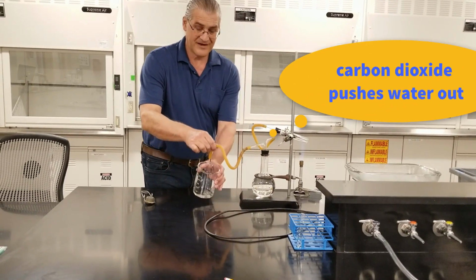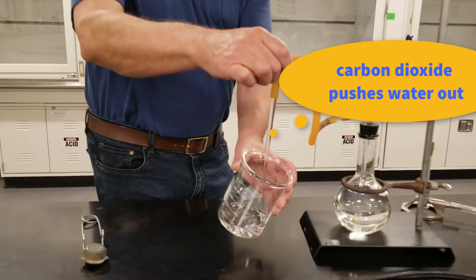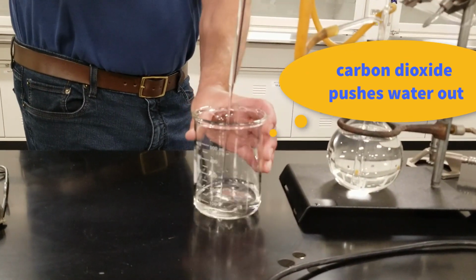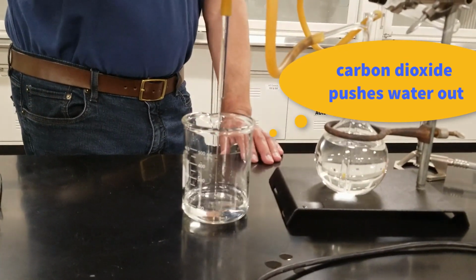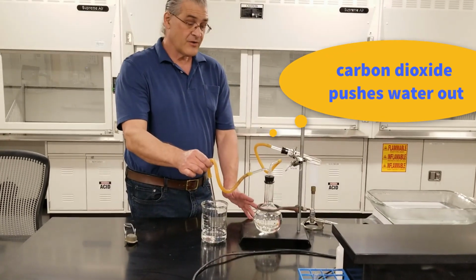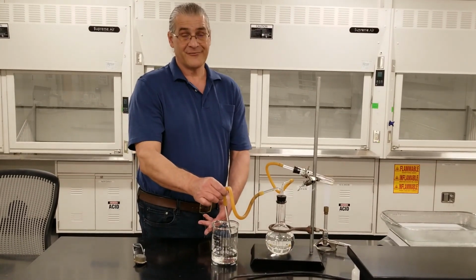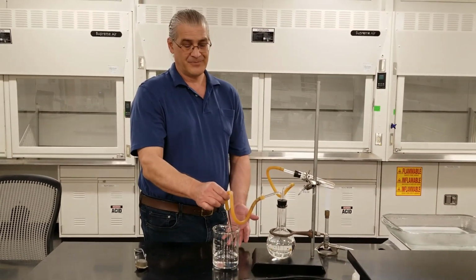So, can you see how it's making the water come out there? And it's draining this flask. So this is really just to prove to you that the reaction is taking place. Also, this lets you know when the reaction's done. If there's no more water coming over, the reaction's done.